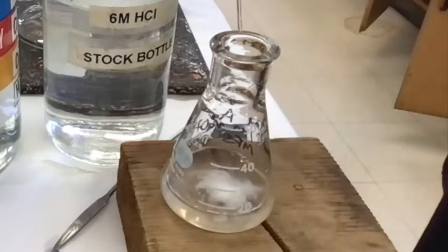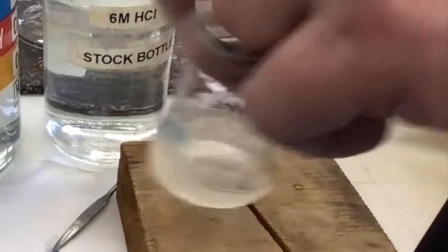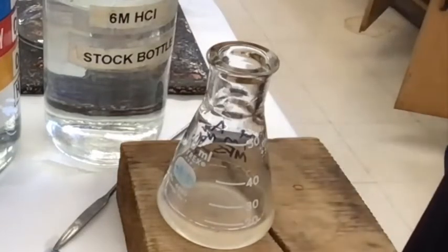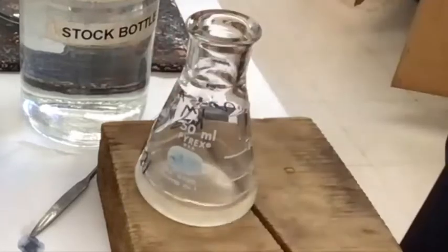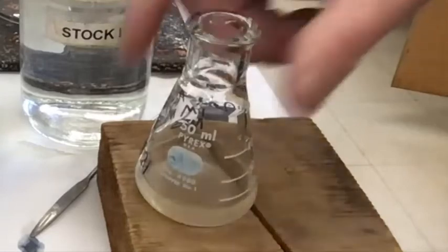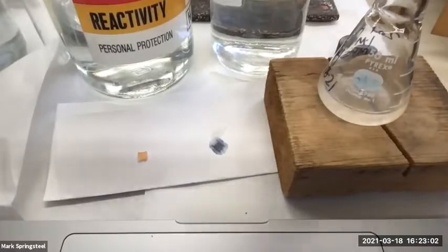Now you see we're starting to get to the point where we've quenched all the sodium hydroxide. Not quite. So do you think the solution is acidic or basic right now? If the precipitate is not sticking around, then it should still be basic. Yeah, but once it starts sticking around, then it's neutral or acidic. Let's check really quick since we're here. Why not? Okay, let's go. Swirl my thing around. Let's see. Is it still basic? Still basic. Good job.